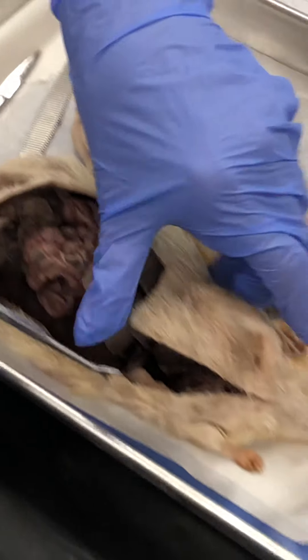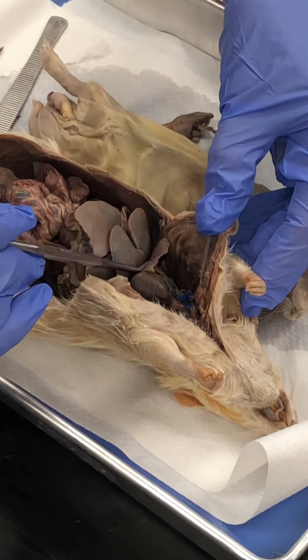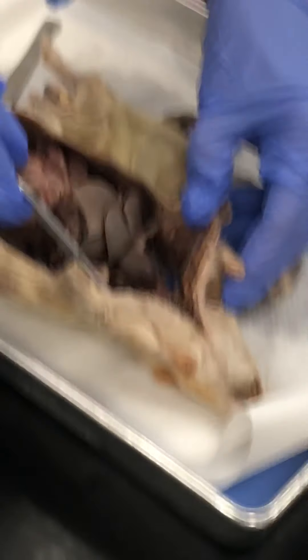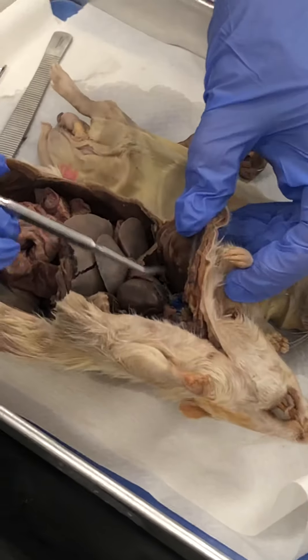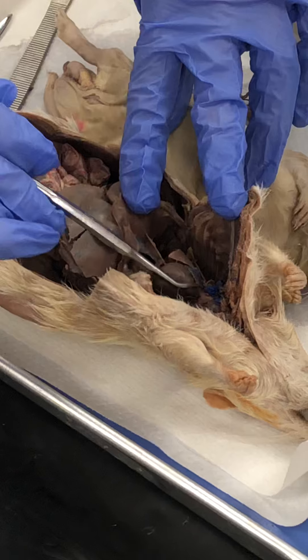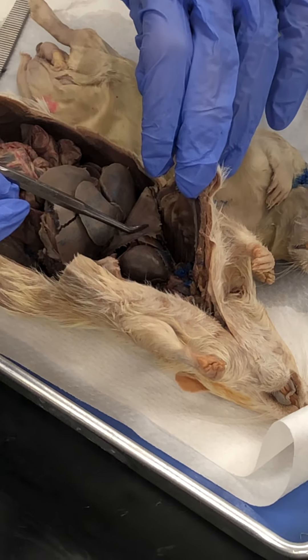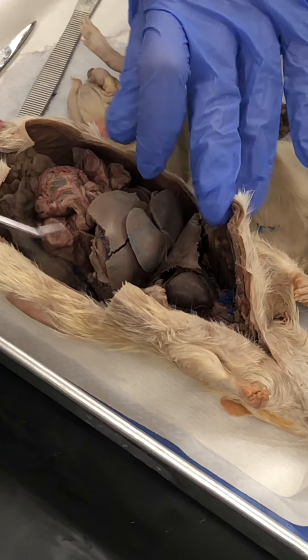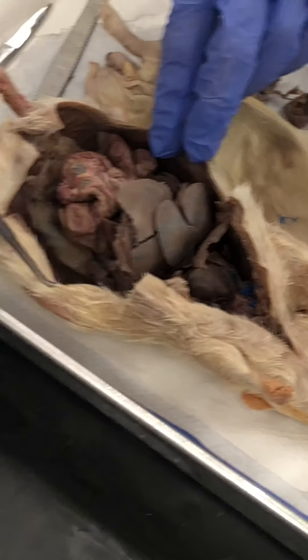You have to know the thoracic cavity — the diaphragm is what separates it. If you are above the diaphragm, you're in the thoracic cavity; this is the lung and that's the heart. Then this is the diaphragm. Below the diaphragm is the abdominal cavity.